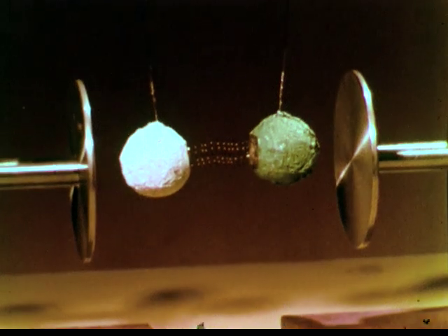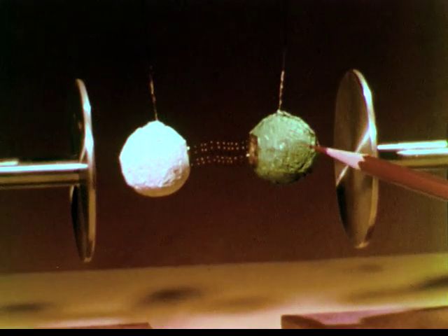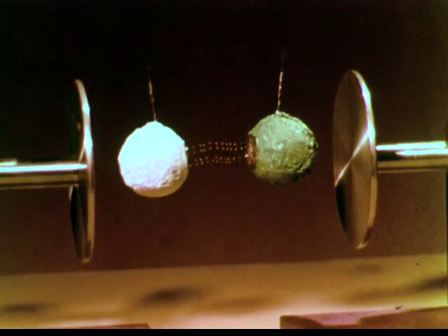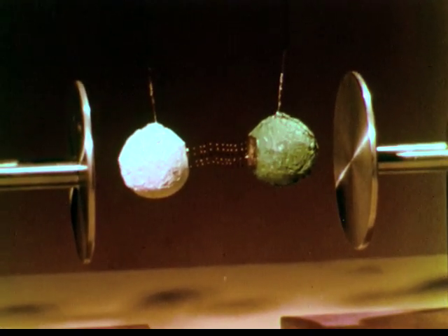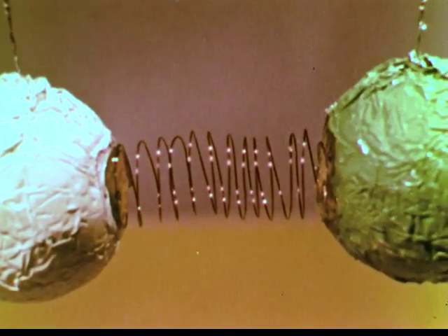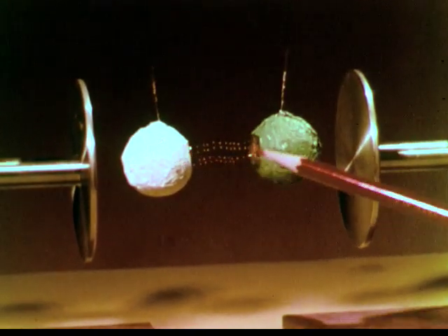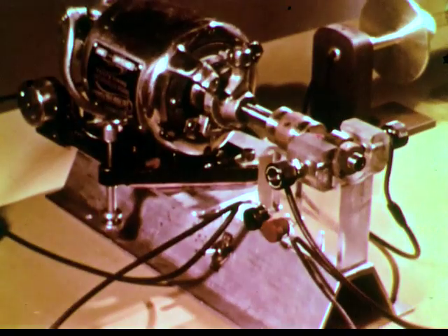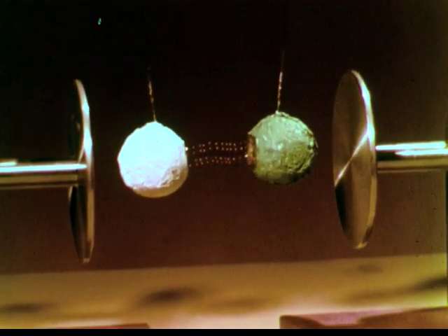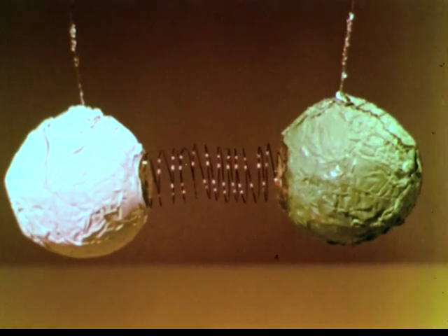To model the hydrogen chloride molecule, we can use two lightweight spheres connected by a spring. These, of course, represent one hydrogen atom and one chlorine atom, held together by a bond. The spring rather accurately represents the bond. We have put a positive charge on the hydrogen and a negative charge on the chlorine. With this motor, we can switch the charge on the condenser plates back and forth, and we can observe the effect of the oscillating electrical field on our model of a molecule.